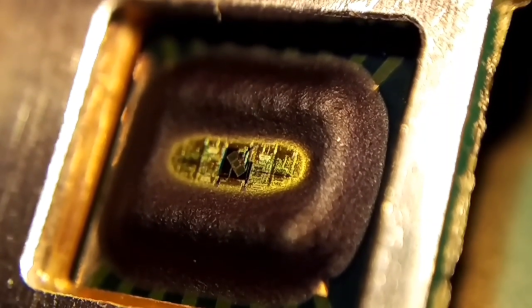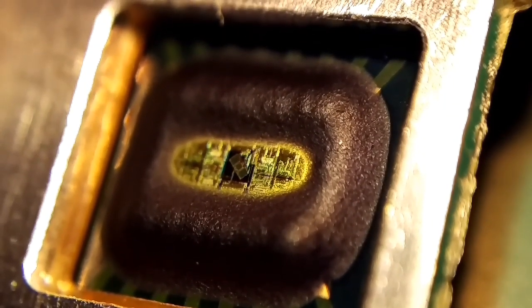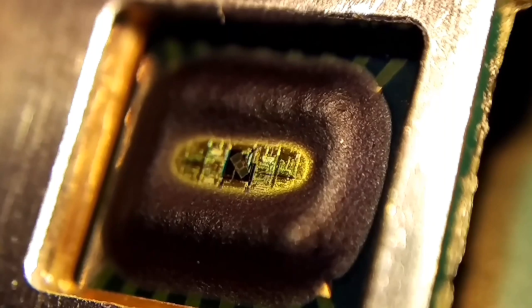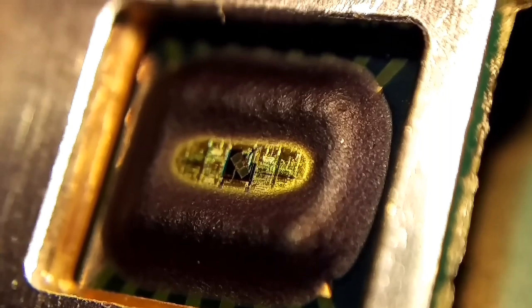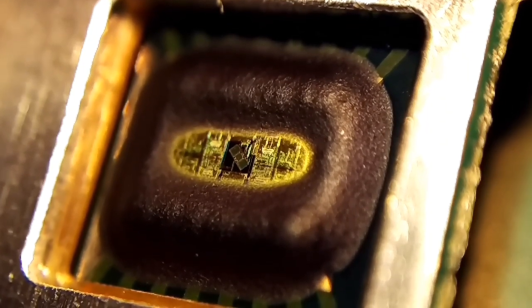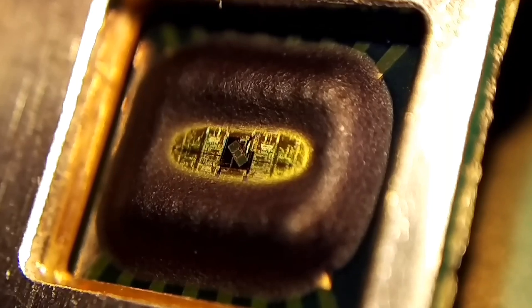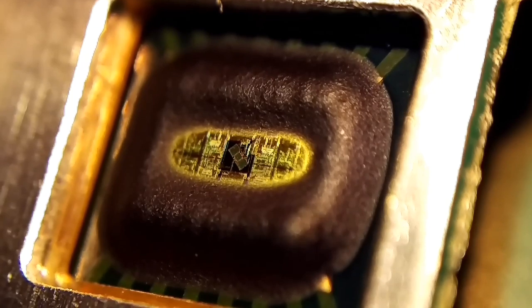Today, slightly different start. So, what you're looking at is a sensor chip from a CD DVD player, and you might notice that the sound probably will be a little bit different for a while, and that's because I'm recording this on my mobile phone. In this video, I will show you how to take pictures or videos at such magnification like you see right now, using your mobile phone quite comfortably and using stuff that's probably lying somewhere around you.